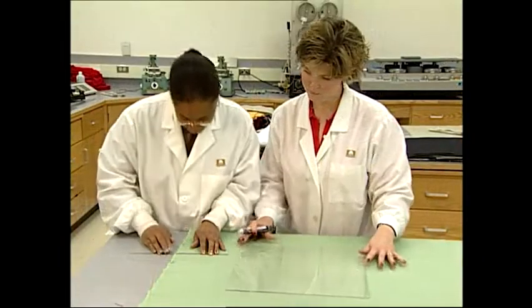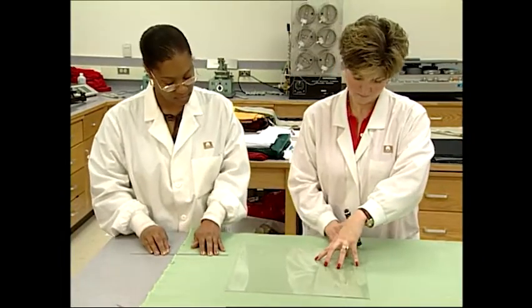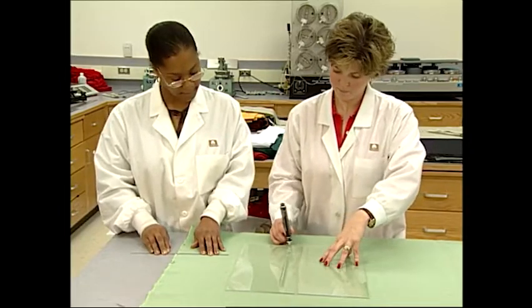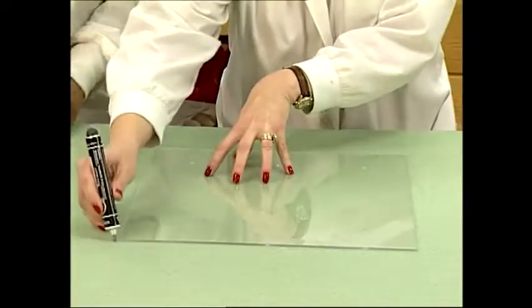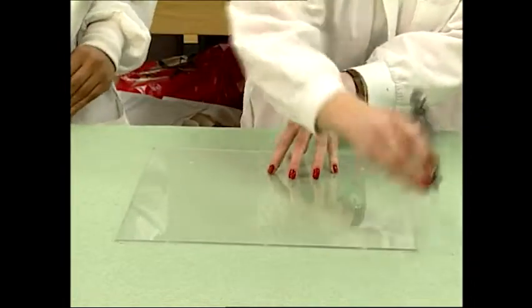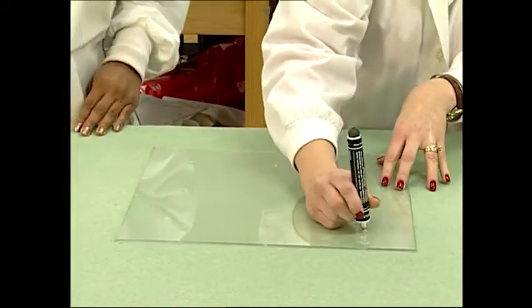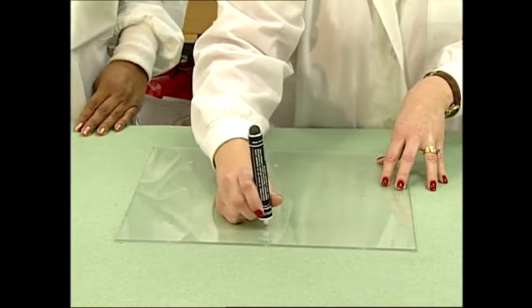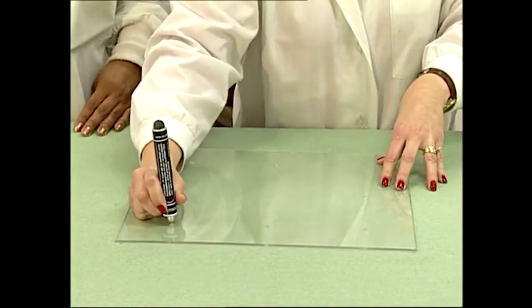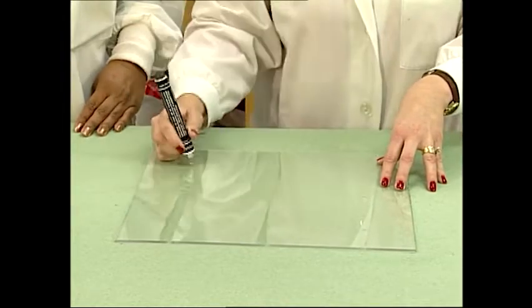In the preparation step, samples already properly conditioned must be carefully and consistently handled. Place the 15 by 15 inch square template on the fabric. Align the template's straight edges parallel to the selvages or width edges of the fabric and to the top and bottom edges of the sample. Make sure that the edges of the template are more than 10 percent from the edges of the sample's dimensions.